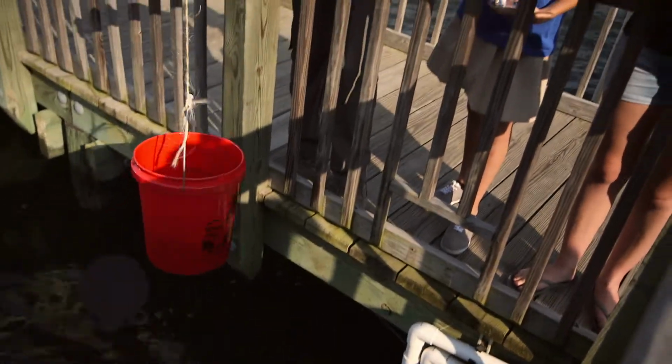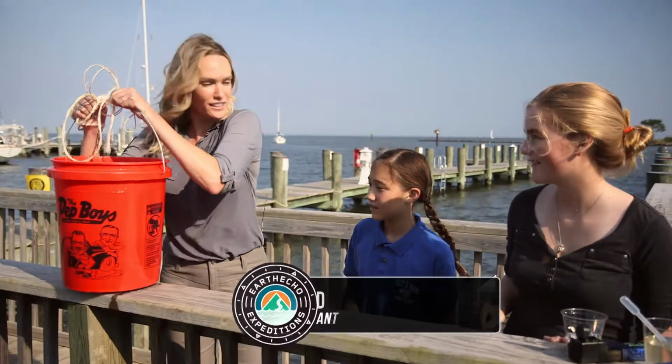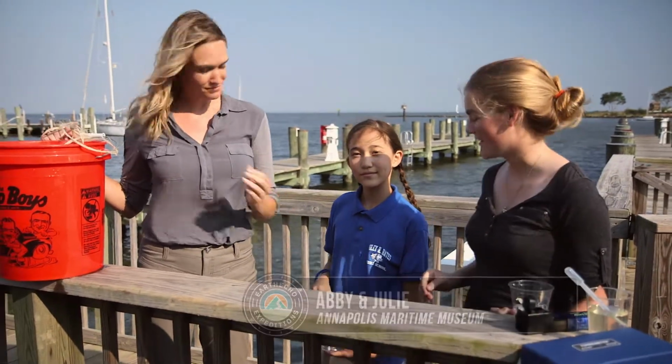All right, I am here at the Annapolis Maritime Museum, and Julie is going to show us how to test the turbidity of water. All right.